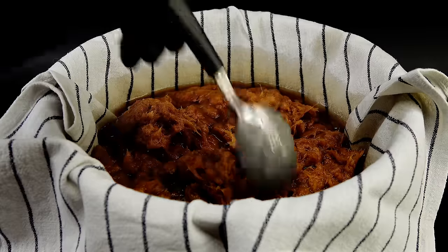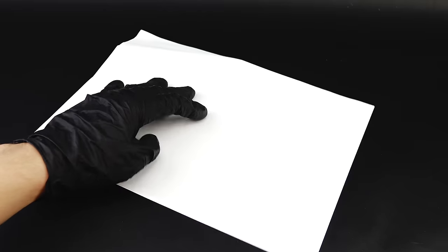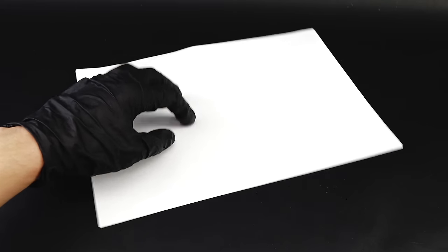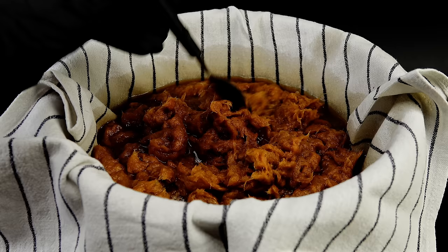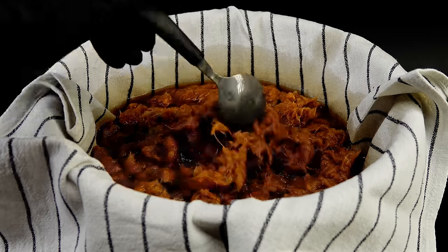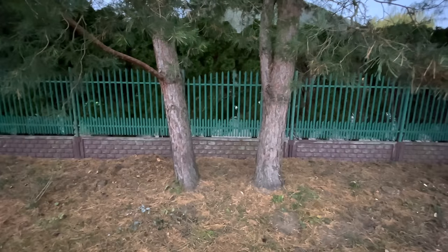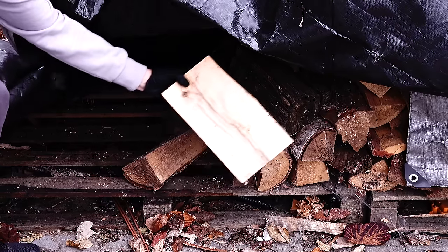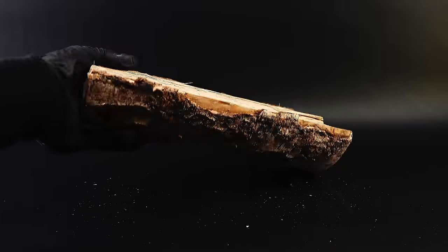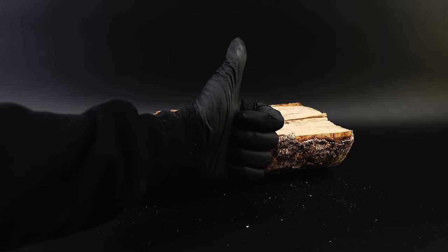Anyway, to start making rayon, I first need to gather some cellulose. Apart from extracting it from trees, I could also just use something like paper to skip this whole tedious process, but it's way too cool to just ignore. To start, I of course have to find some wood, and instead of getting it from a tree myself, I let someone else do the dirty work, and just went and got a piece of firewood from my driveway pile. This single piece should be much more than enough for the whole project, and to extract some cellulose from it, I have to bathe it in a few angry chemicals.